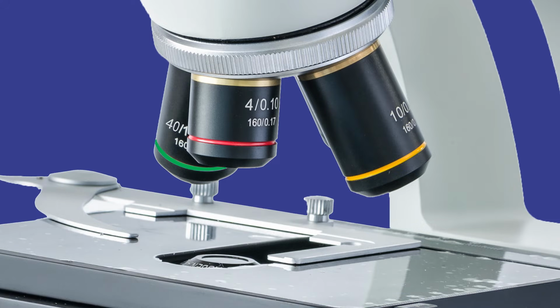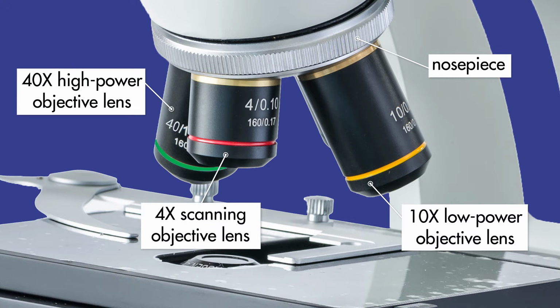Just above the stage is the nosepiece. The nosepiece contains the objective lenses, which are the microscope's main lenses. A compound microscope usually has 3 to 5 objective lenses, each with a different magnification power. Each objective lens snaps into place when the nosepiece is rotated to the proper position.